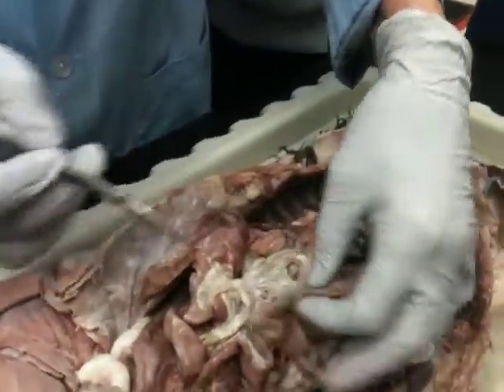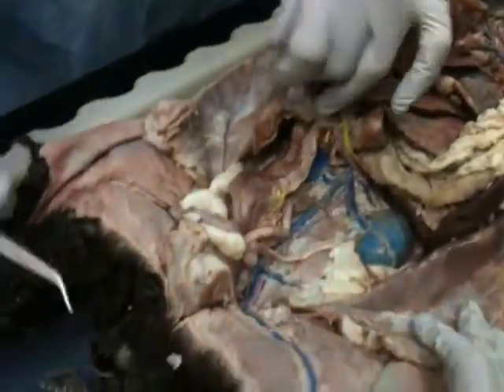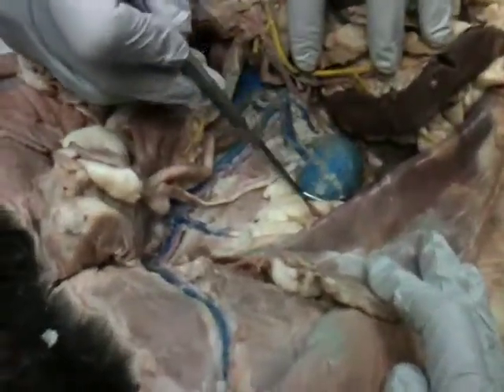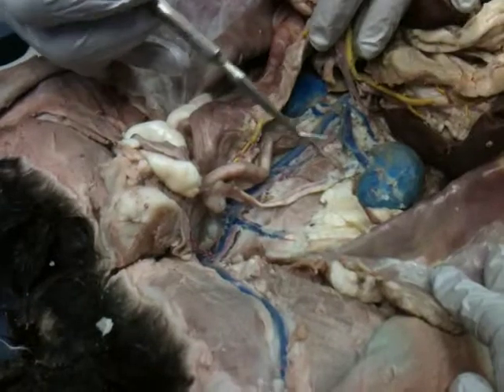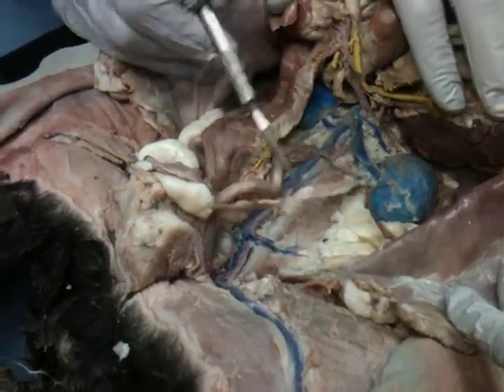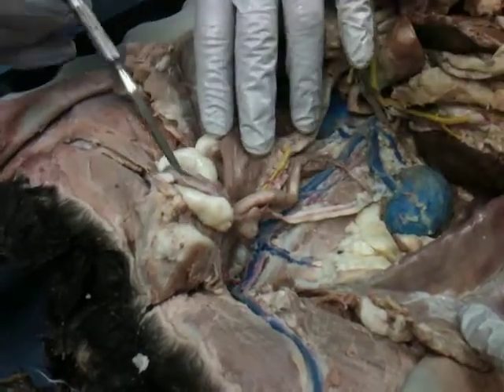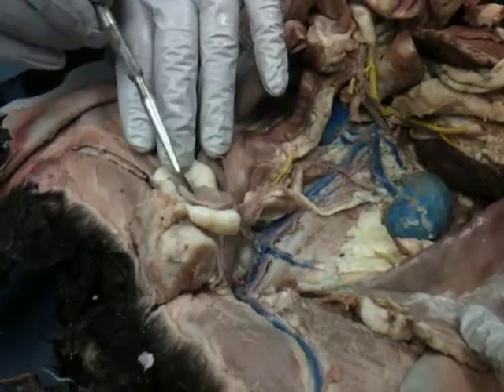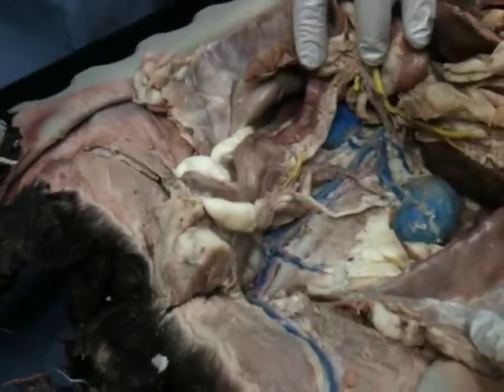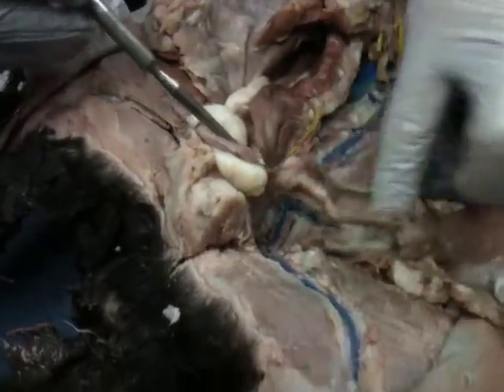So then it goes on to the large intestine, the colon. It extends down here to the rectum. Other organs that you'll see down here: here's our kidney, in the renal area, the left kidney. We have the ureter, which takes the urine from the kidney to the, what's this guy? Urinary bladder. Okay. This is a female cat, and we have the two horns of the uterus.